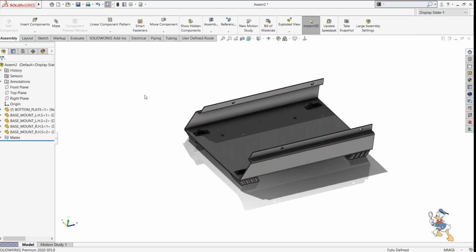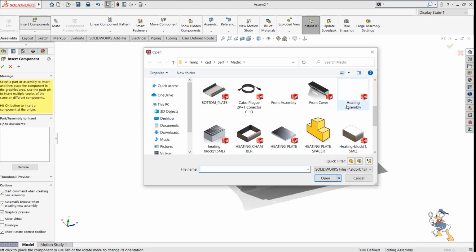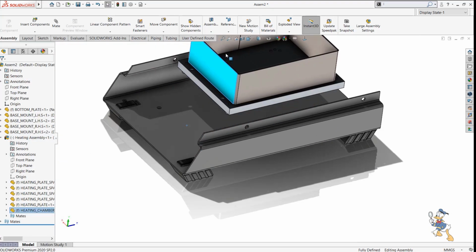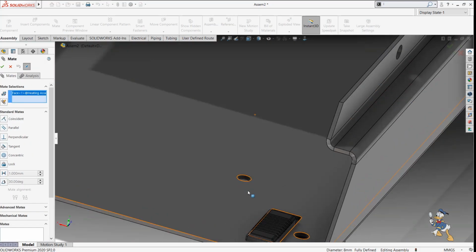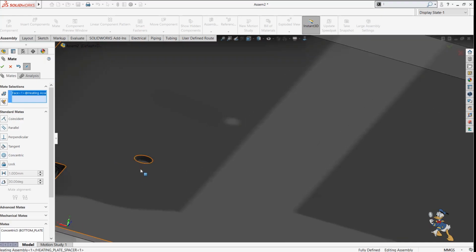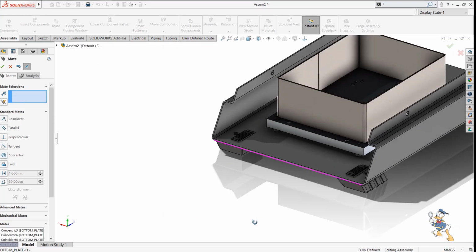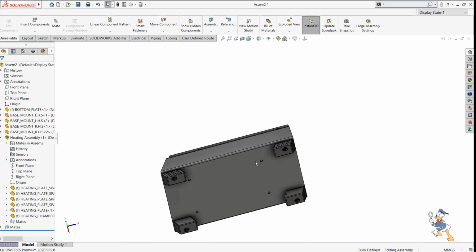And suppose we just need to make a heating assembly. So we need to call a heating assembly right now. Heating assembly is this. I can place it over here, and I just need to make it float, and I will provide some mates for this assembly with respect to this. And it is a concentric. Suppose I need to make this one concentric as well. So I'll make this one concentric. I just need coincident with this. So I have made coincident to this value as well. So now it is okay for this.